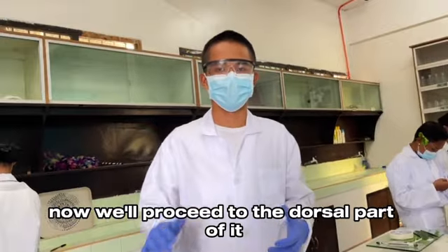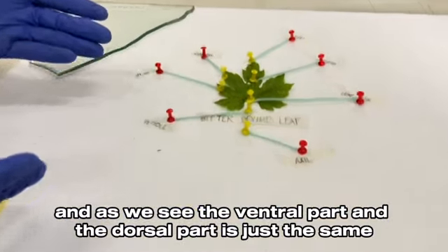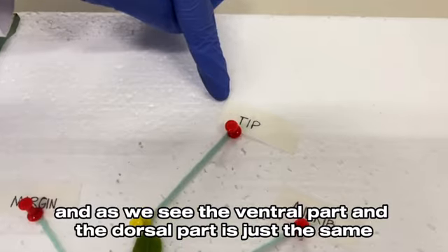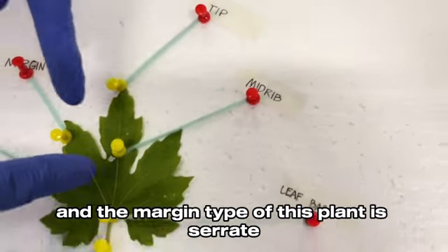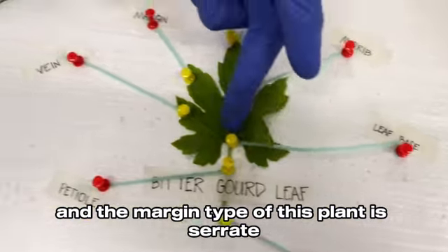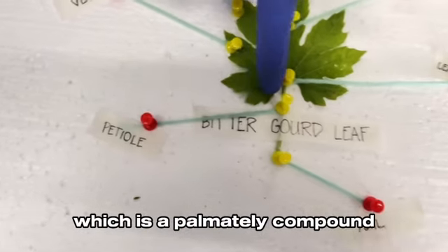Now, we'll proceed to the dorsal part of it. As we see, the ventral part and the dorsal part are just the same. The venation type of this plant is palmate, and the margin type is serrate. The type of leaf is compound, specifically palmately compound.